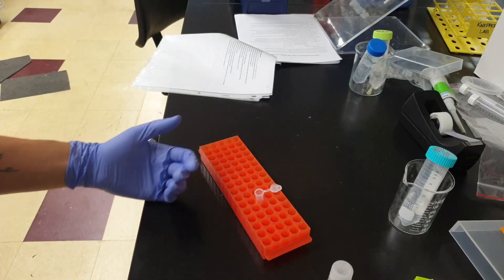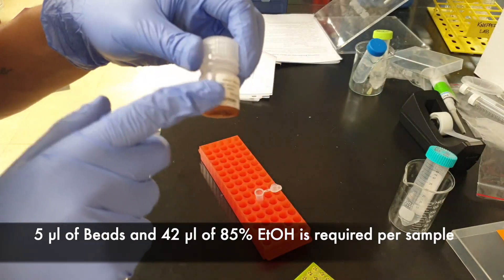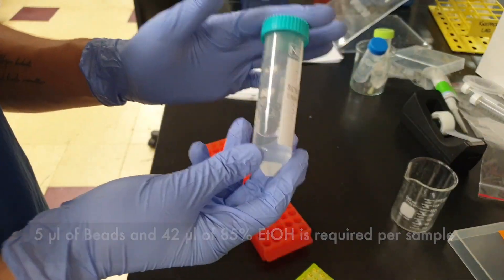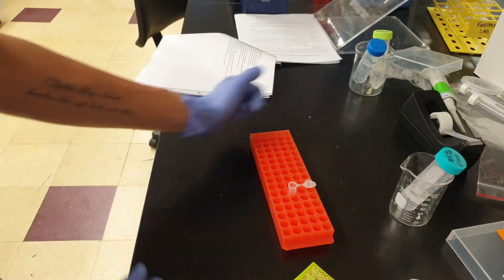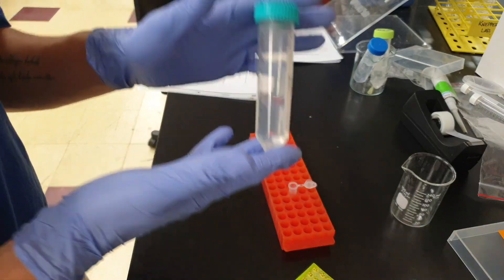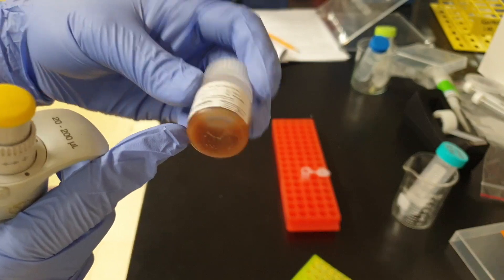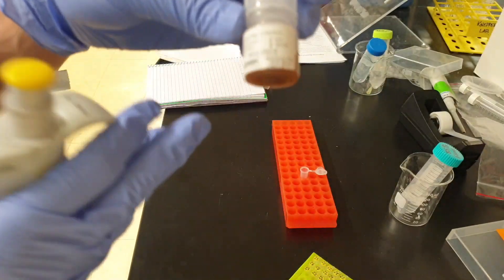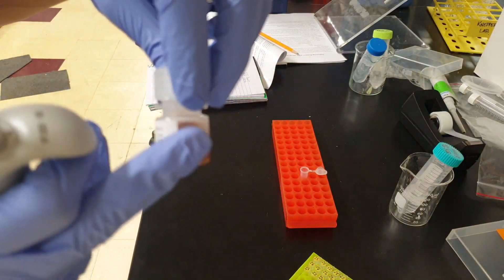First step will be making the master mix. I have 20 samples, and per sample we're going to be using 5 microliters of beads and 42 microliters of 85% ethanol. After that, we're going to keep using the 85% ethanol by itself, so you need to make a good amount before starting. Before using the beads, make sure nothing is stuck at the bottom of the tube — over time the beads accumulate at the bottom and ethanol sits on top.